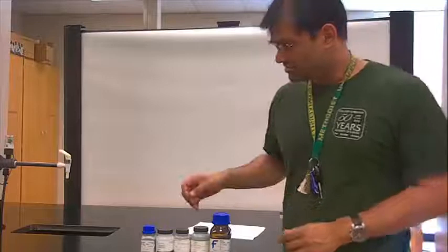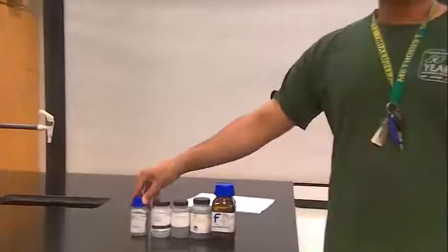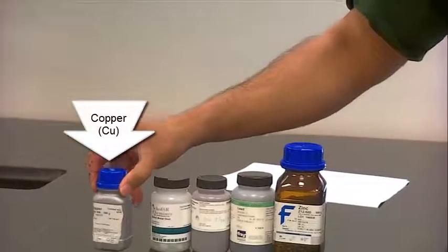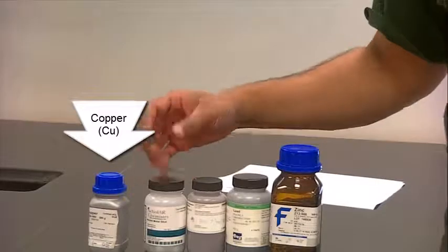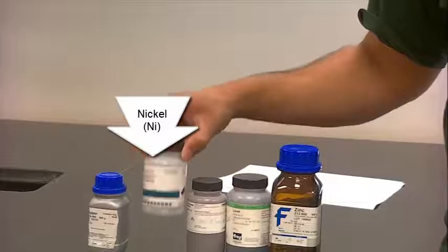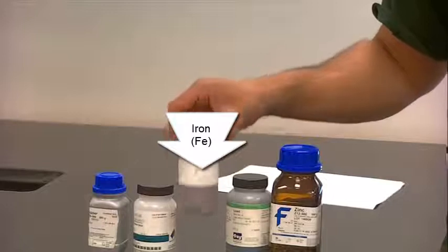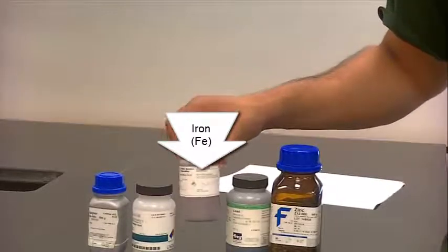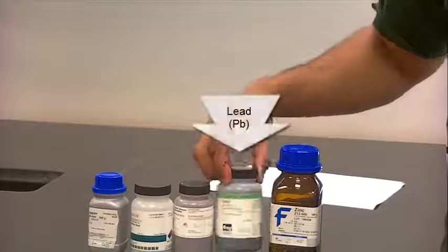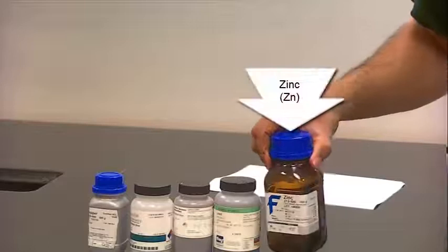So before we go into determining the density of these metal solids, let's just show you the metals that you will work with. First is copper. It's pretty heavy, so when you see it in the lab and weigh it out, you can just feel that it's dense just by feel. Then there's nickel. Now, my opinion is it's kind of light. Then there's steel. Okay, that's iron. Okay, this is pretty heavy. Okay, this is just my qualitative observation. Here is lead. Okay, it's kind of intermediary. And then finally we have zinc.